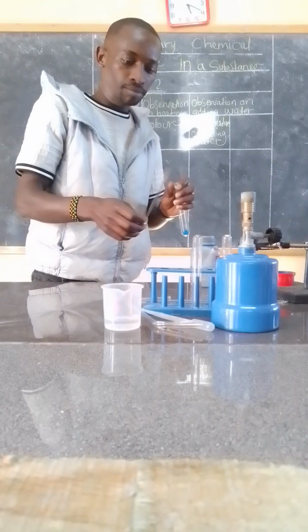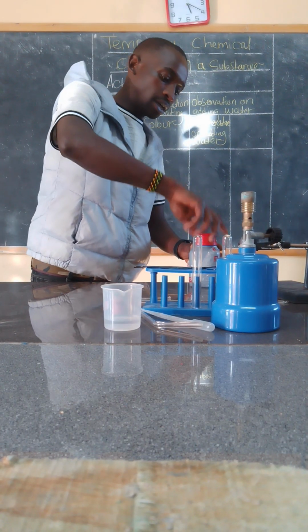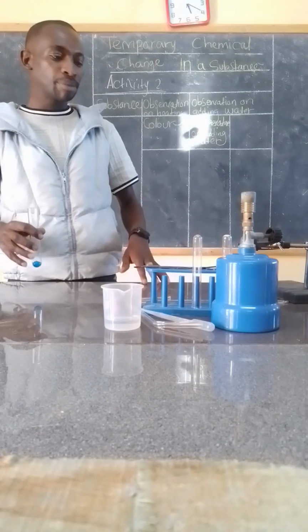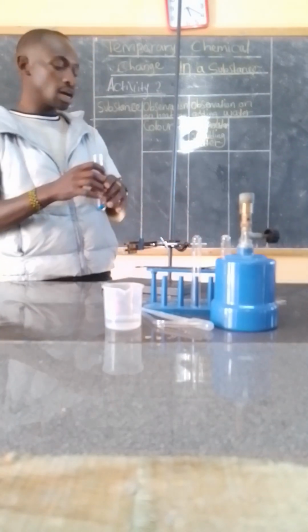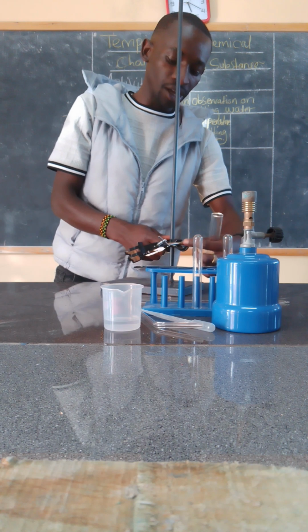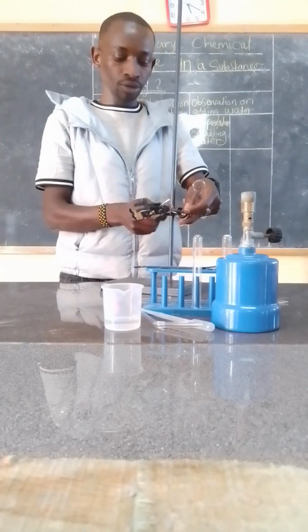Then I must ensure that I observe safety, as well as taking care of my apparatus. I'm going to set up just the way you'll see, so simply be there to observe and see what I'm going to set up.